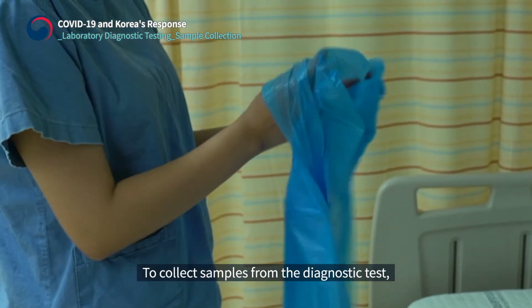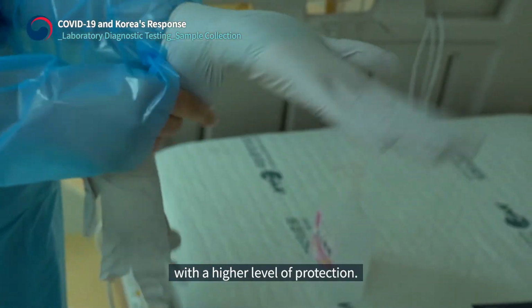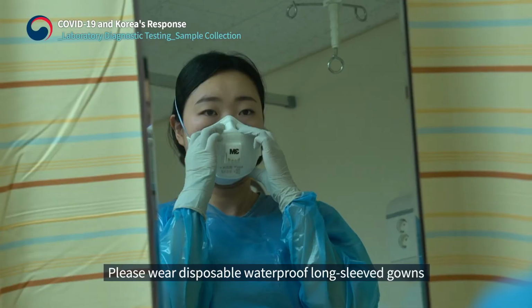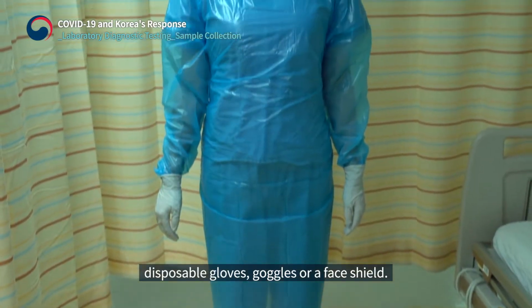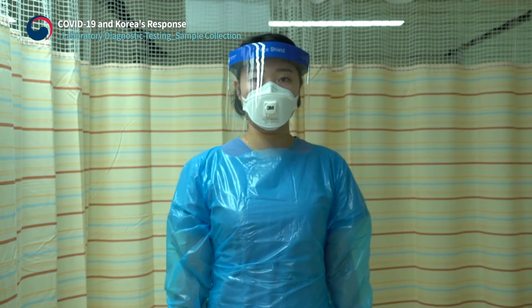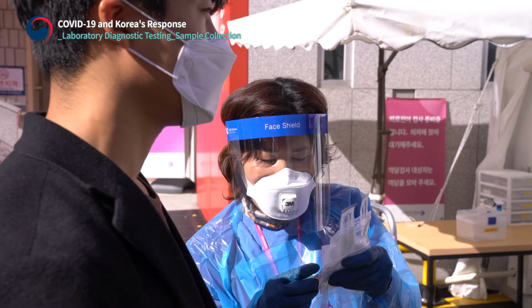Collect samples from the diagnostic test. Wear a KF94 mask or personal protective equipment with a higher level of protection. Please wear disposable waterproof long-sleeve gowns or full-length protective clothing, disposable gloves, goggles, or a face shield. When collecting samples, stand sideways to prevent droplets from spreading.